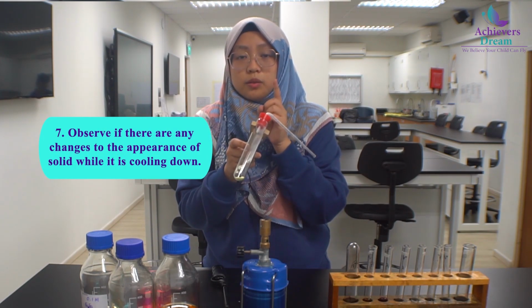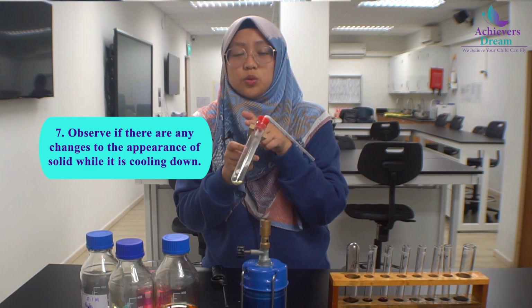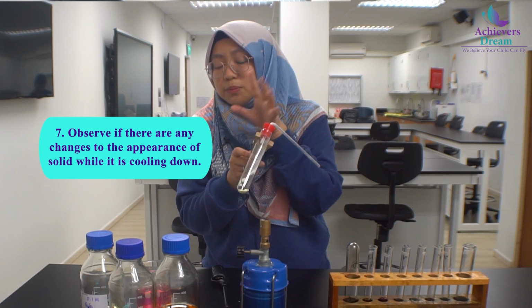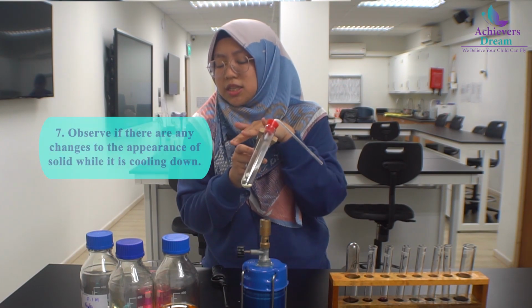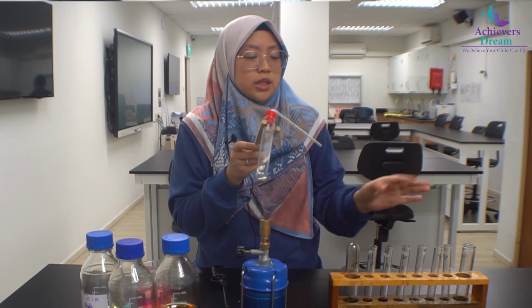Before you submit your paper, check on the boiling tube to see what the appearance is. As you can see, the bright yellow solid has started to fade, and eventually when it has cooled down, it will appear white. But please also remember, do not touch the hot boiling tube, just leave it in the test tube holder.